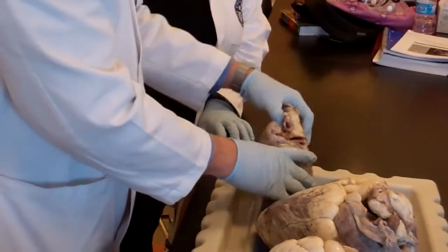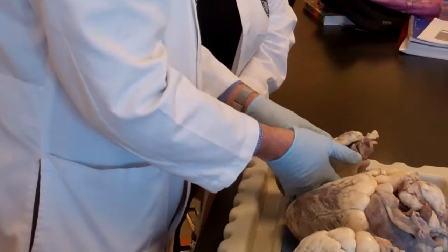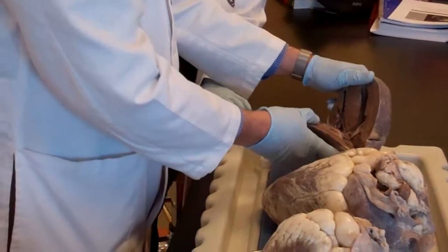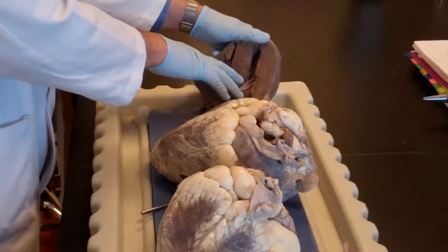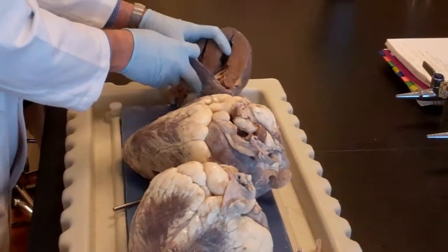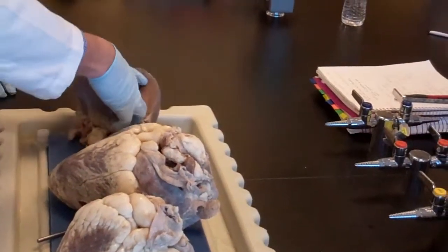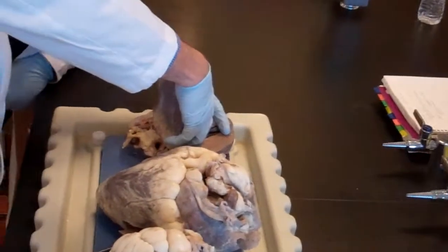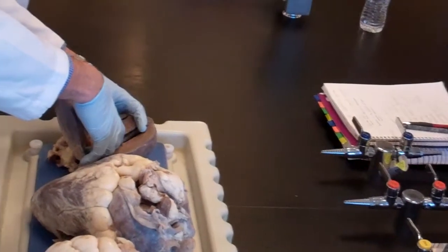You want to see it here? Do it again. Okay? See, here I cannot show you, but if I want to flip it over now that I know what the situation is, okay? You see that this is the left ventricle, this is the right ventricle, this is the tricuspid, this is the bicuspid. You see two cusps already? Yes? You see the chordae tendineae, you see the papillary muscle. Okay, please don't cut it this way, all right?